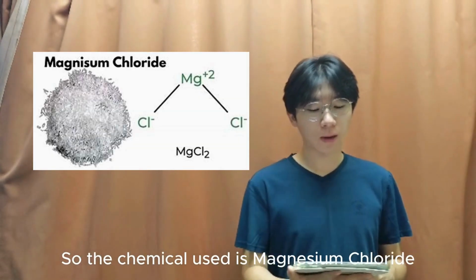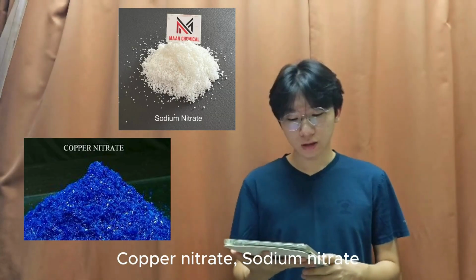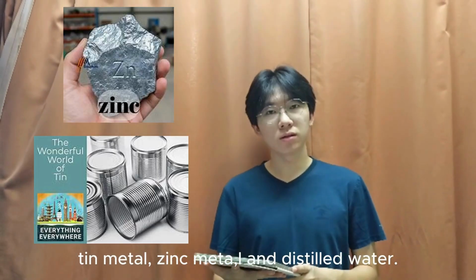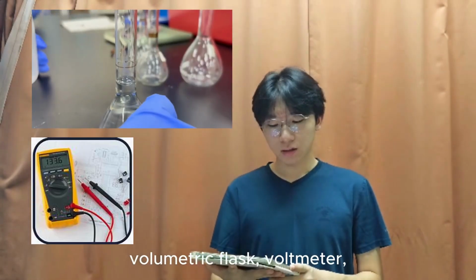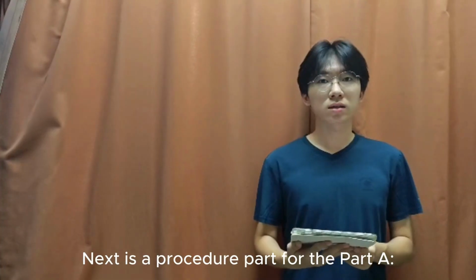The chemicals used are magnesium chloride, zinc sulfate, tin chloride, copper nitrate, sodium nitrate, copper metal, magnesium ribbon, tin metal, zinc metal, and distilled water. The apparatus used are beaker, volumetric flask, voltmeter, dropper, crocodile clip, and filter paper. Next is the procedure part.